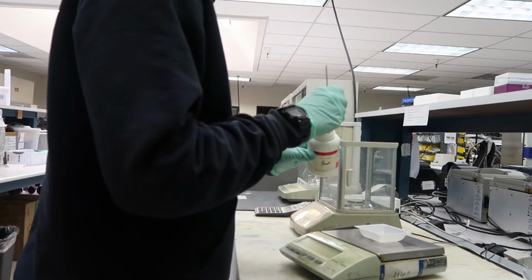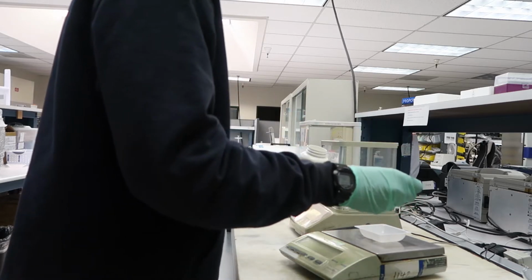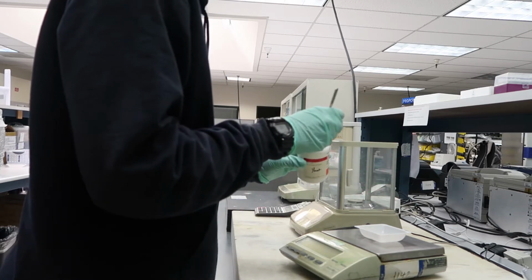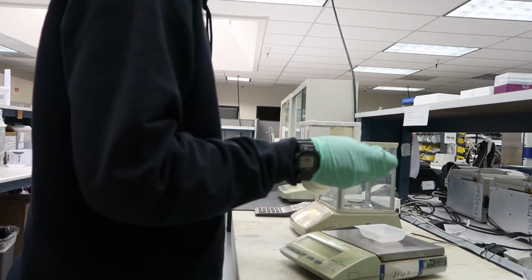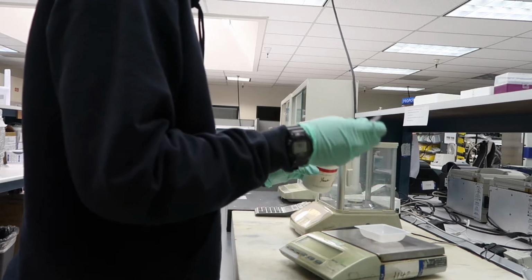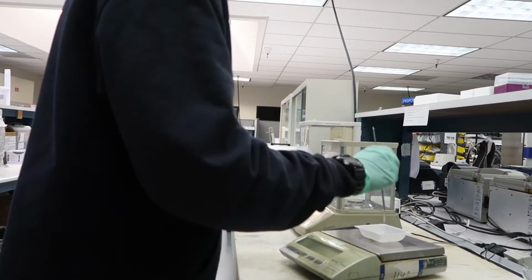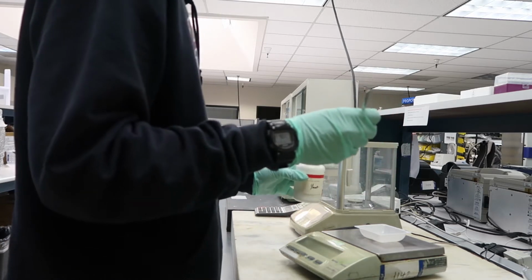It's a natural polysaccharide that's derived from seaweed and red algae, and when it's cooled below 45 degrees Celsius, its repeating chains form double helices that allow it to create a 3D structure. Now I'm making 1% Agarose gel, and that's going to have about 100 to 450 nanometer pores.